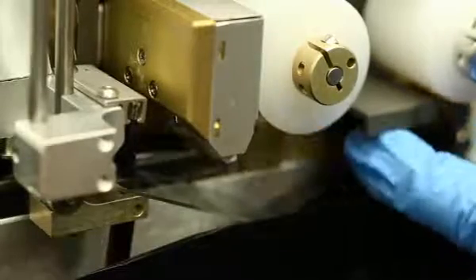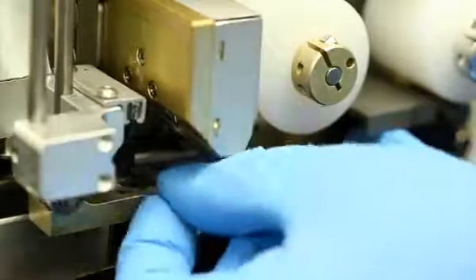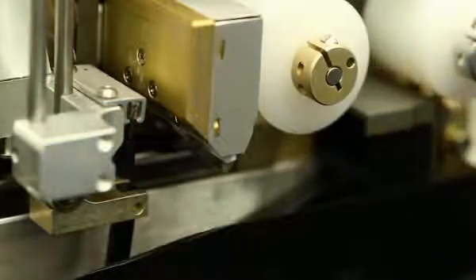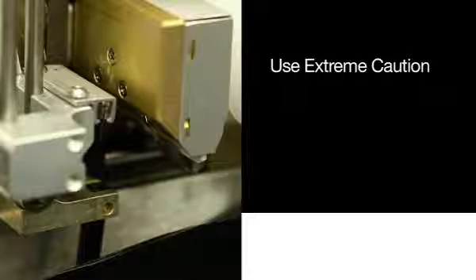Step 3. Look for the jammed object and try to slip it clear along its length while holding it on its flat sides. Use extreme caution as there may be broken glass. Do not use excessive force, which may result in breaking a slide.